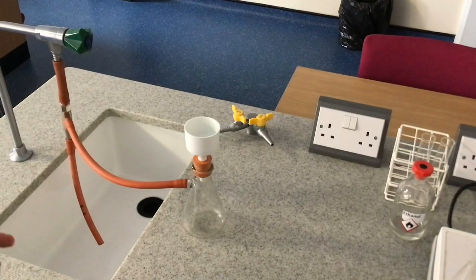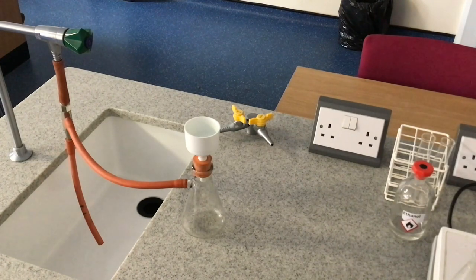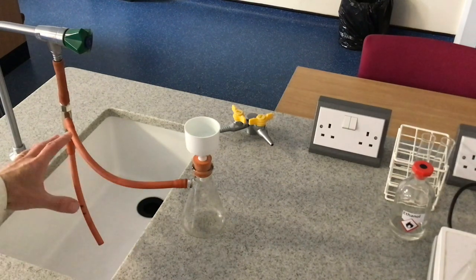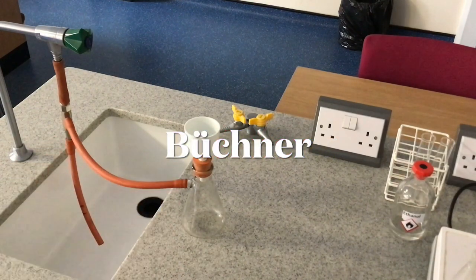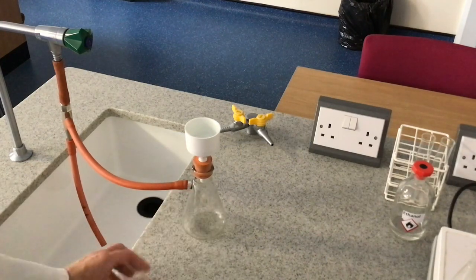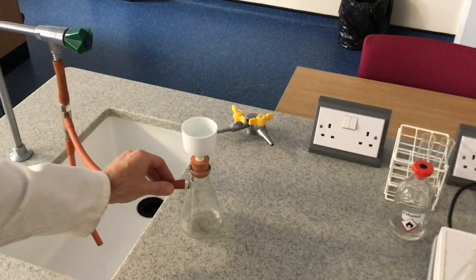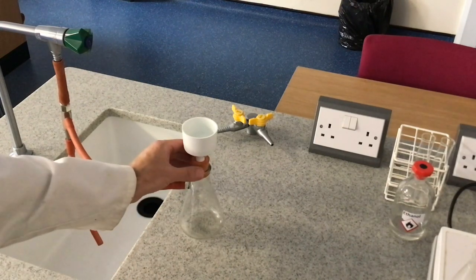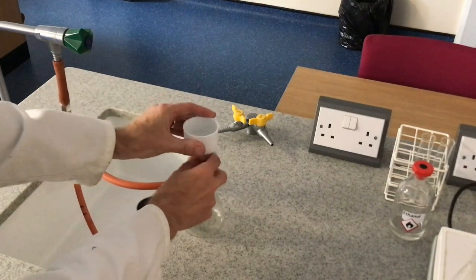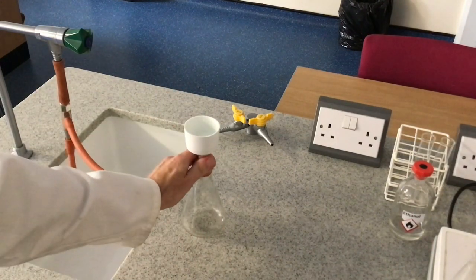For the filtration stage we use what's called reduced pressure filtration, or suction filtration as it's sometimes known. We use this apparatus here — this is called Buchner apparatus. This is a Buchner flask, which is a very thick glass conical flask with a sidearm on it. And we've got this Buchner funnel — it comes in two parts, you can take the top off quite easily. It sits inside the conical flask with a nice seal.